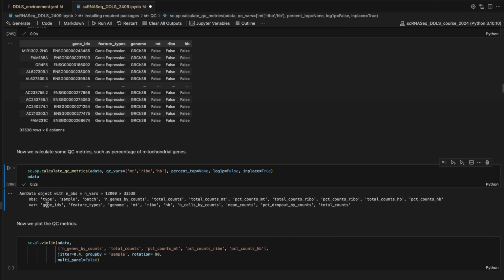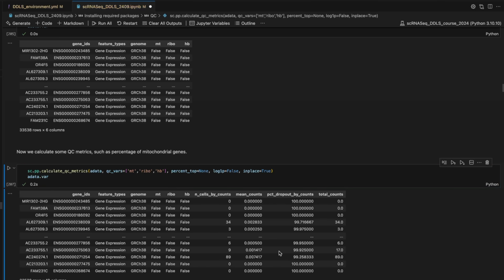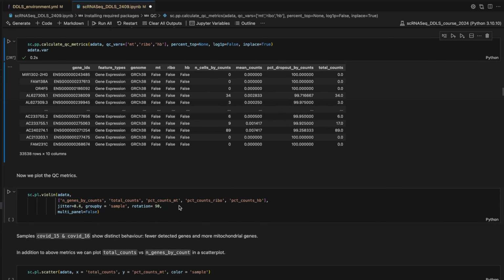Now you can see that in adata var we have the gene ID features corresponding to what we had before, the columns for mitochondrial, ribosomal, hemoglobin, and these new metrics. One thing that we can do is to check the content of this. Here you can see that we have the values for each of these metrics. Now let's do some plotting.